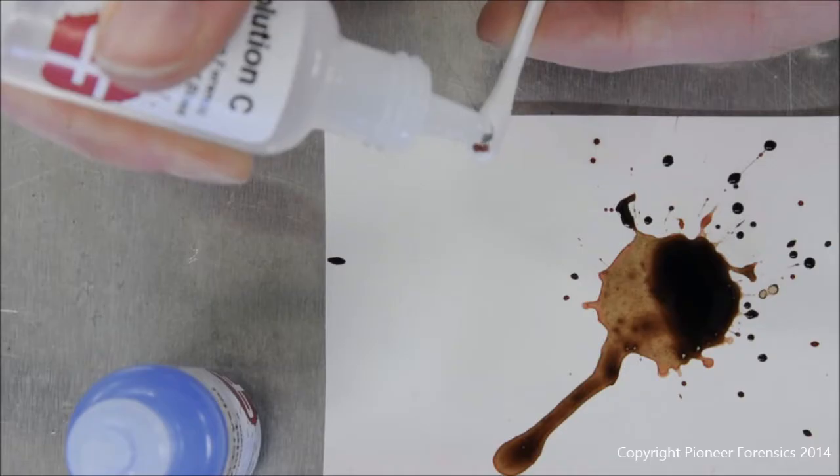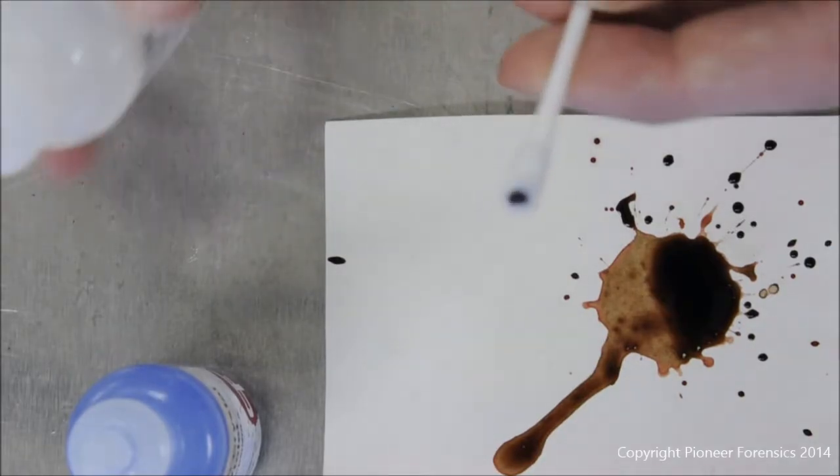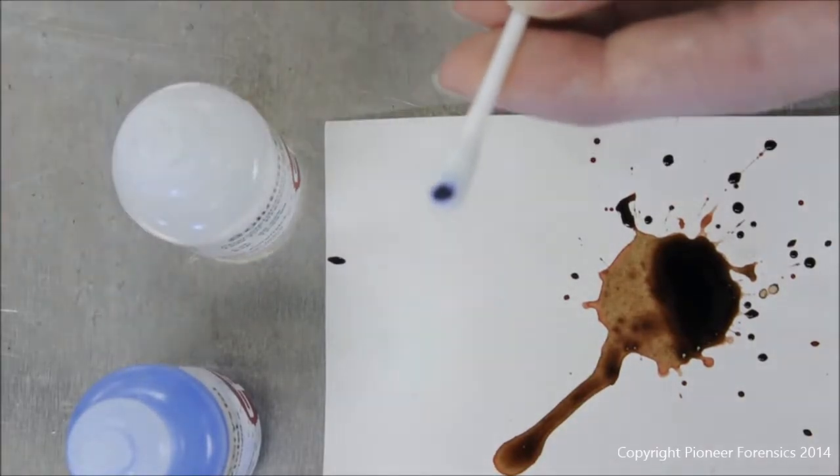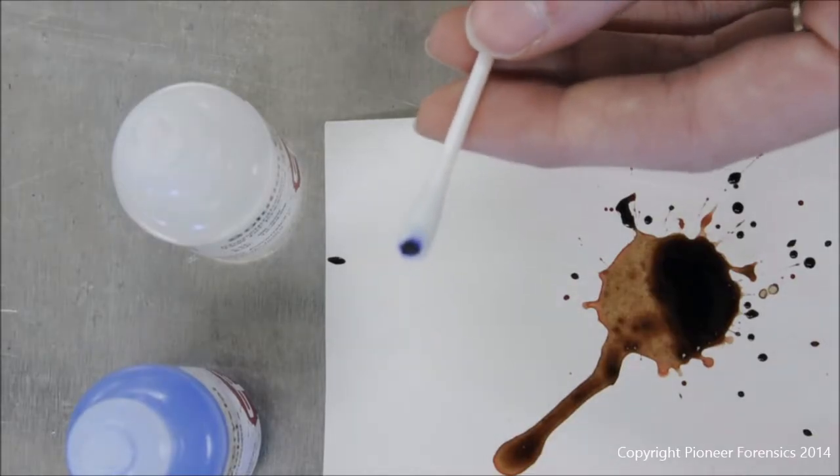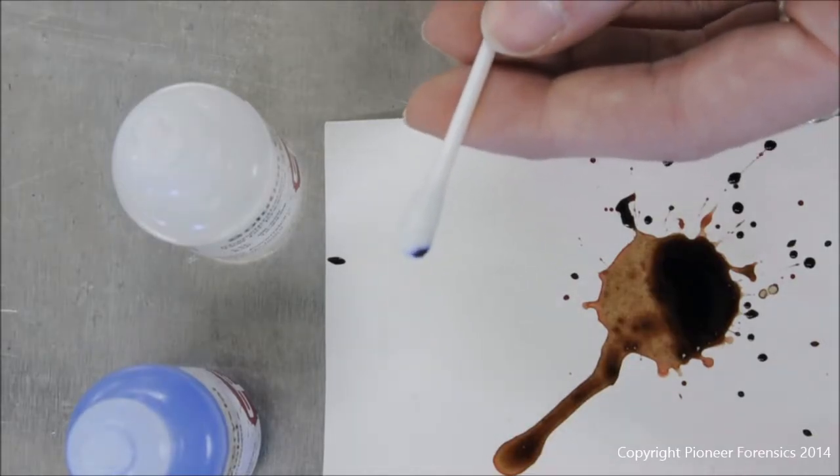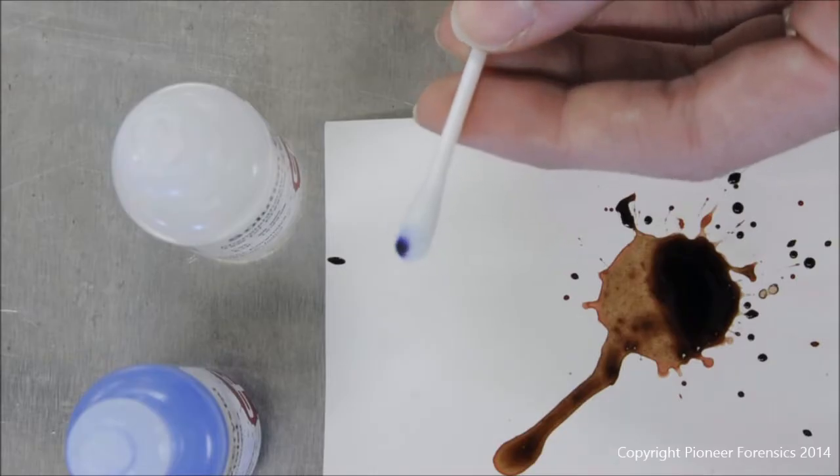This gives you an immediate color change to deep purple, which is a positive presumptive test for blood.